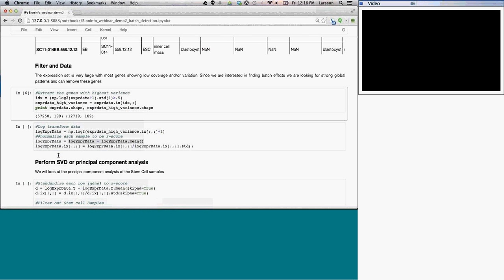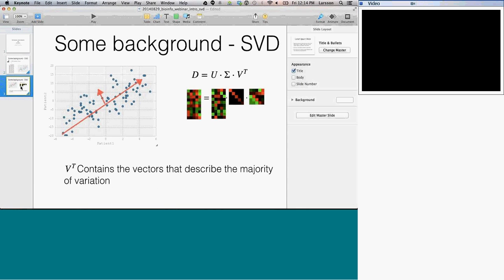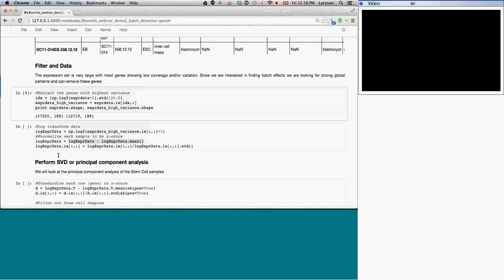Larsson, a really quick question here. Since this is FPKMs, correct, as the expression values in this matrix? That's correct, yes. So by adding one, you're adding a single FPKM to each value prior to log transforming. That's correct. Isn't that too much? I don't think that's going to affect the results significantly. The reason I'm adding one is because I'm doing the log transform, and log of 0 is undefined, so it's just to get it slightly off from zero. And when you do the log transform of one, that transforms to 0.